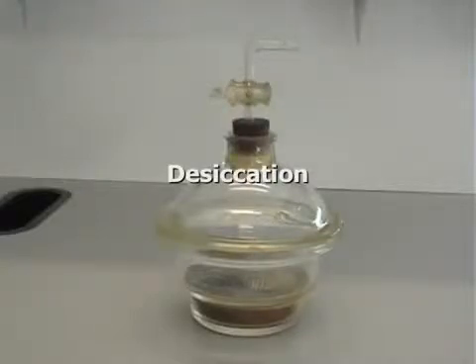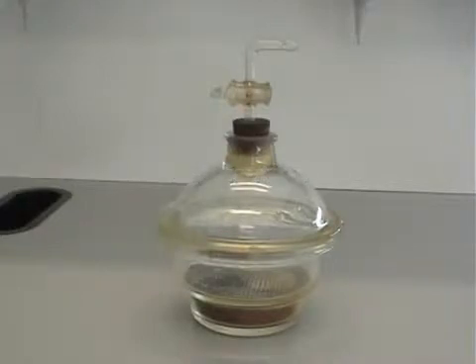Welcome to the inorganic video on drying by using desiccators. Throughout your first and second year studies, all drying will be carried out using a desiccator, unless you are told otherwise.